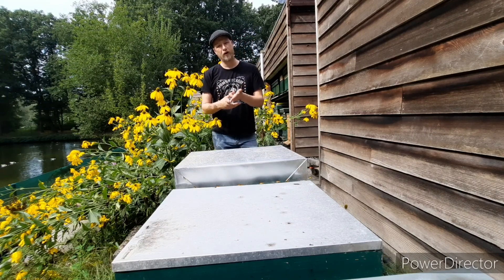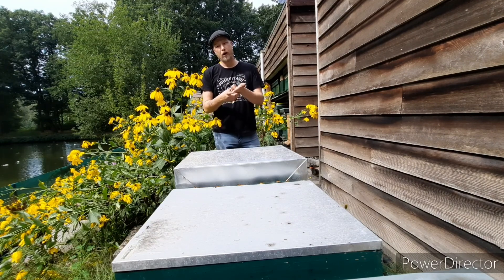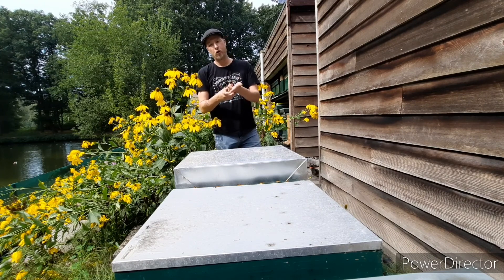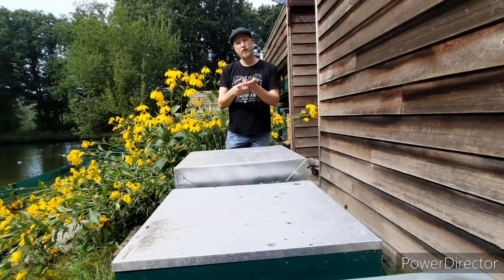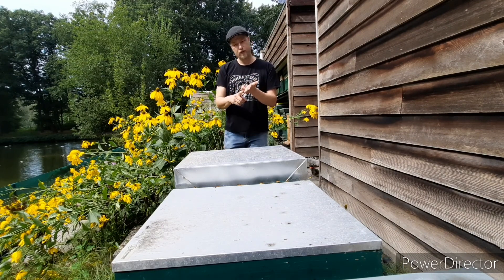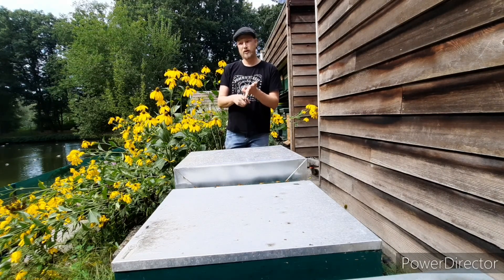It's one of the important things for detecting varroa and then cleaning it out. If they clean it out, the varroa still lives but they can't breathe outside a capped brood cell. So if the bees have that behavior it's very positive. And the test we do today is measuring the mites that are on the bees at the end of the season.